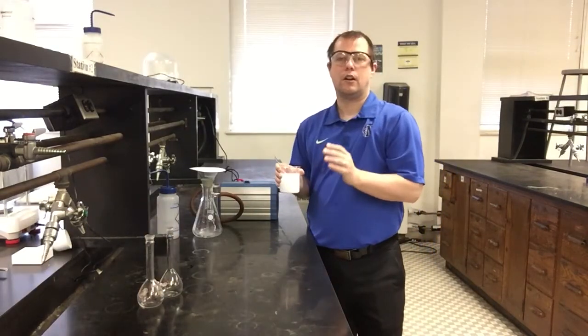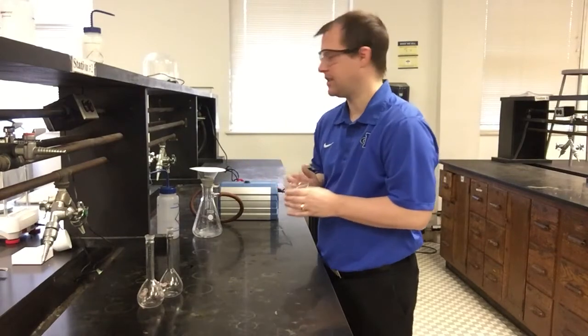That's a good thing. All right, sorry for the cut there. I had to make sure I had the right funnel kind of set up here and ready to go.